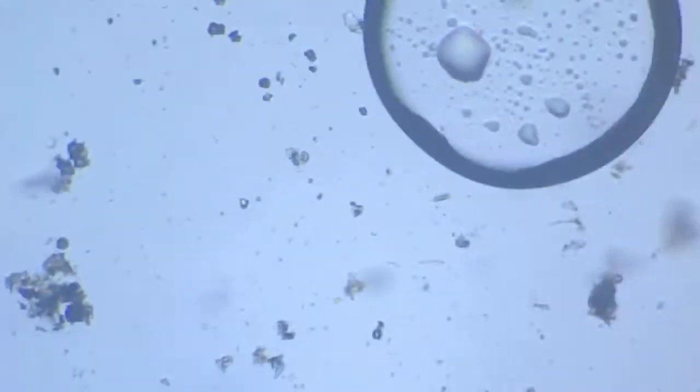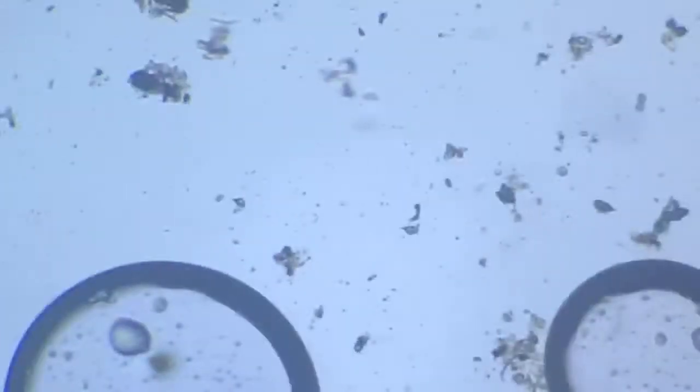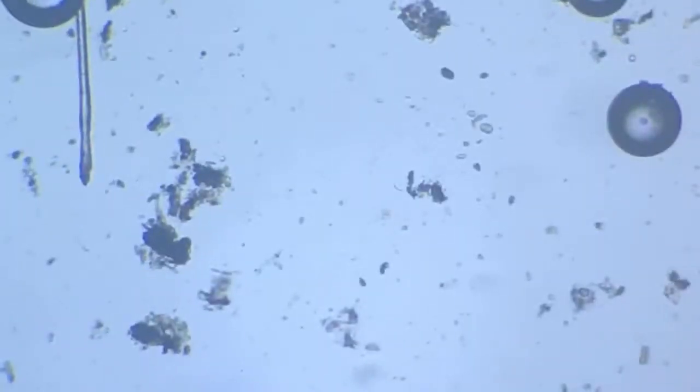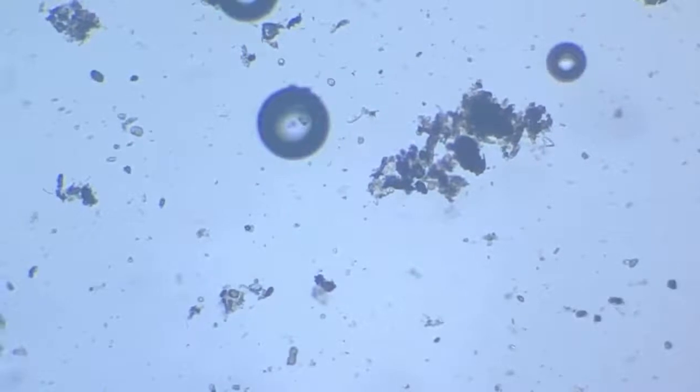Who is this? Struggling with that little debris around there, which contains its food as well. Something flew. Something zoomed past. And it was very, very speedy, in a hurry.